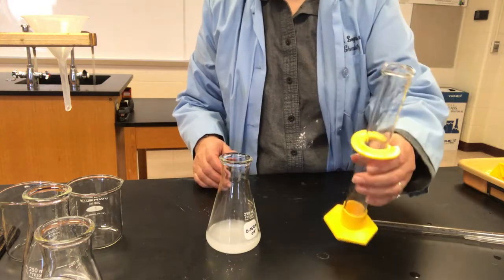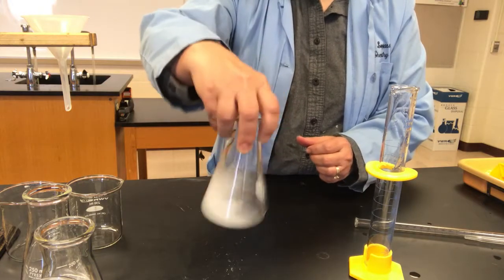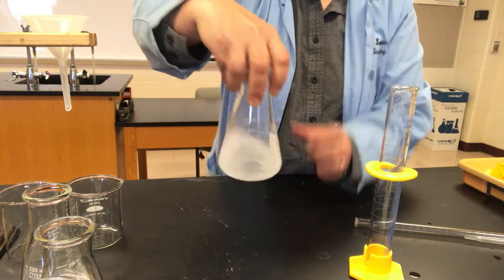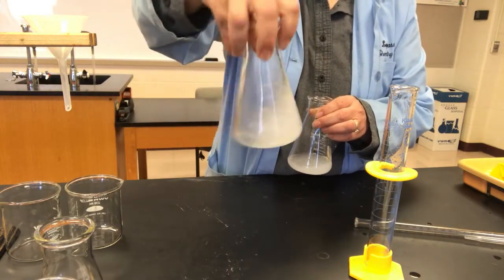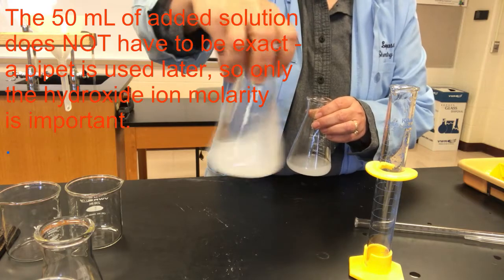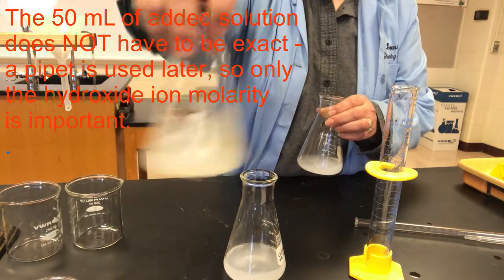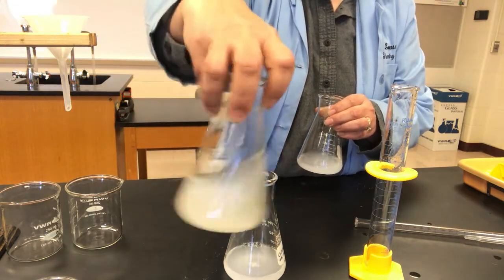The next thing we'll want to do is swirl these very strongly to try and dissolve as much of the solid as possible. But of course not all of it's going to dissolve, because it's a slightly soluble salt, so it's not 100% soluble. And there's common ion present that's going to further suppress the solubility. So they're going to be cloudy.